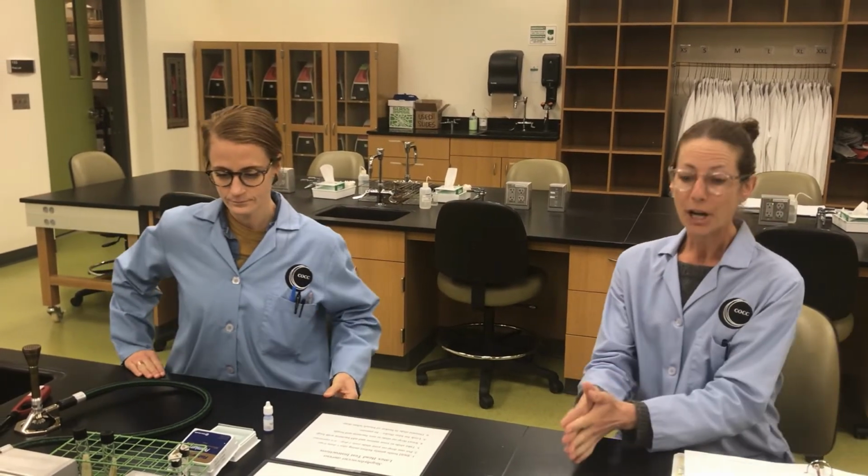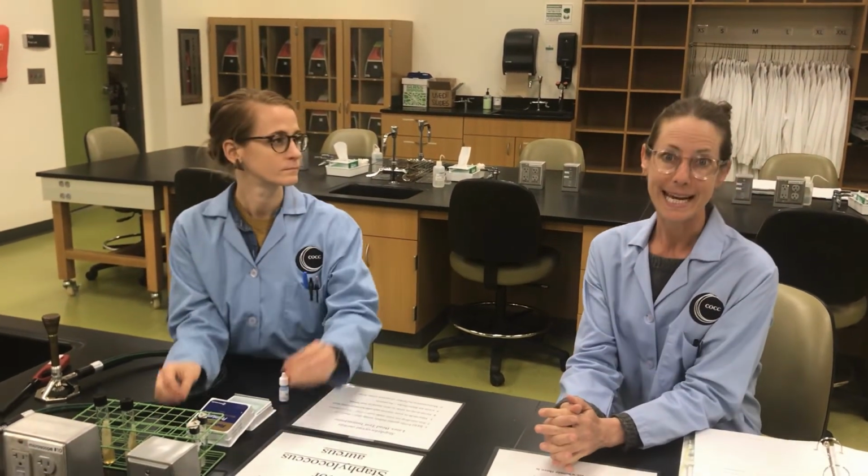Hi there. In this portion of the video, Amanda and I are going to show you the coagulase test results and then walk through doing the latex bead test and recording those results as well. So for coagulase, each tube contains rabbit plasma and the bacteria that we tested, and we started this earlier because it takes several hours to incubate.